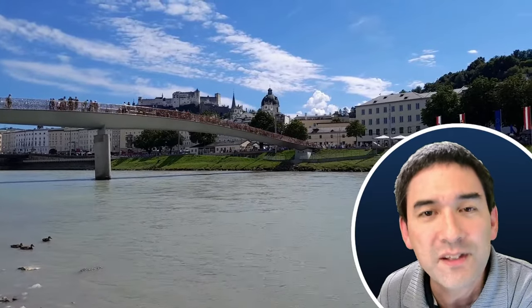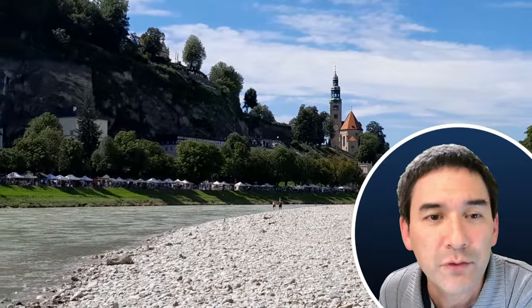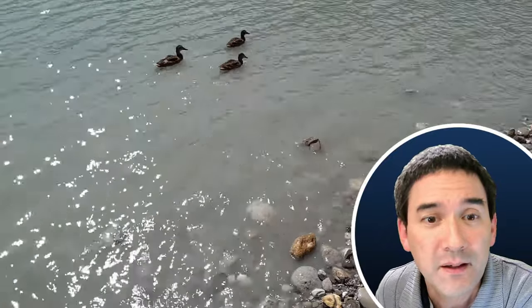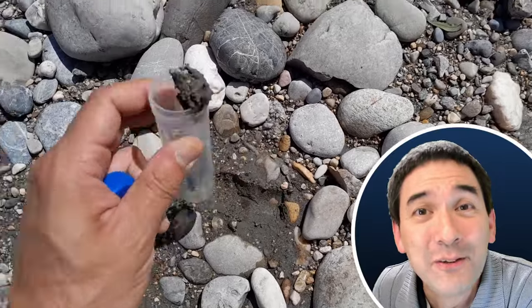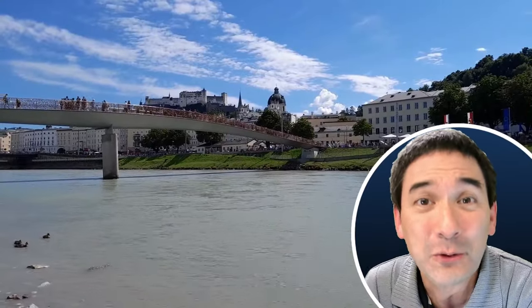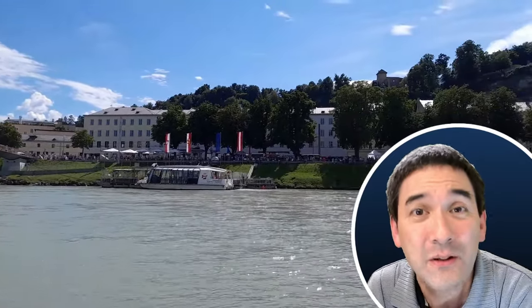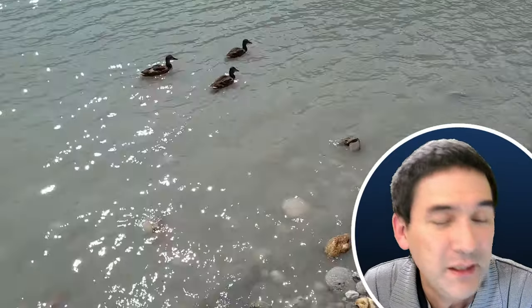The name of the river is the Salzach, and it's quite well known that it contains a little bit of gold. I said I want to go find some gold using the microscope — not expecting to find any. I did not find any gold, but I actually found something that looked like gold. A little bit of research showed that this is iron pyrite, also known as fool's gold, because some people in the past confused it with gold. I want to show how it behaves differently from real gold.